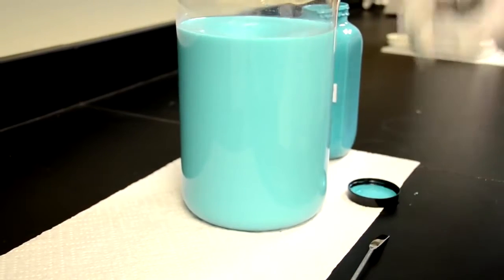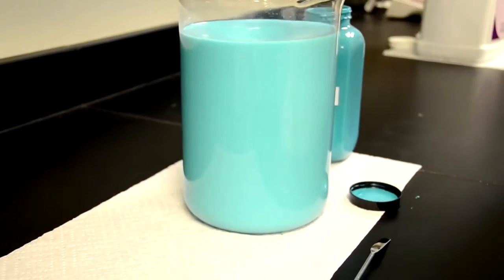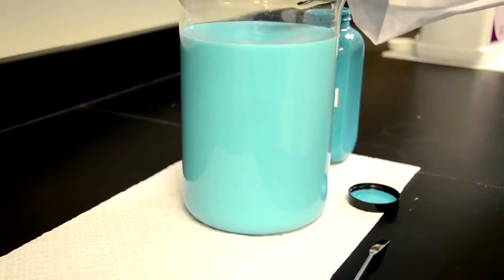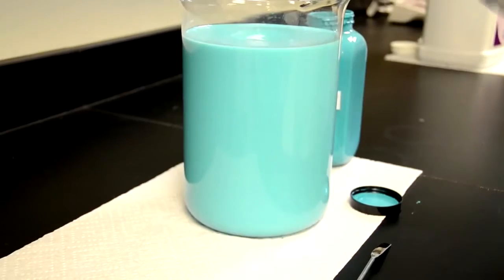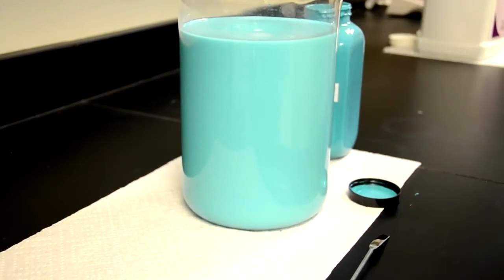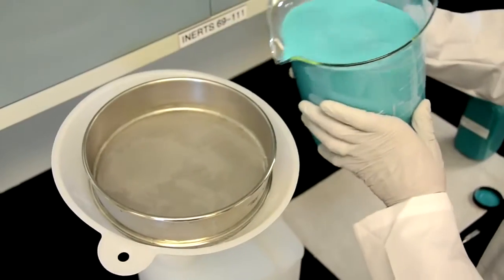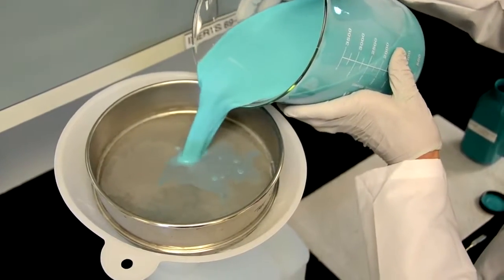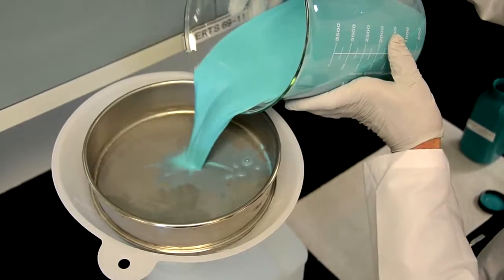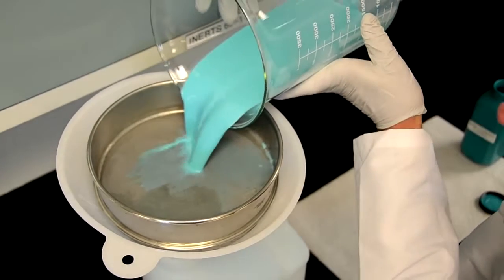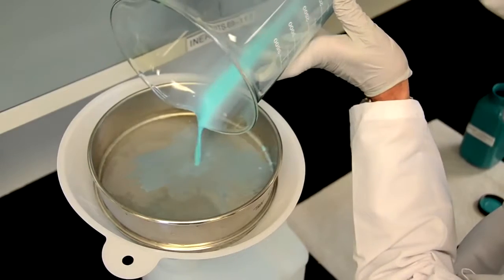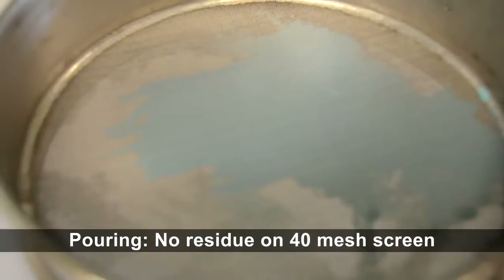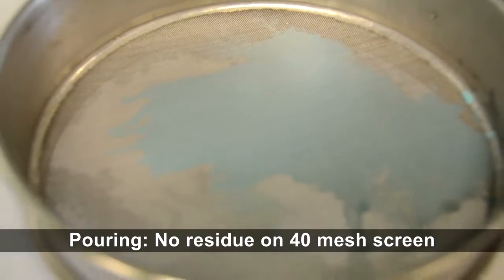And now what I'll do is take this mixture and pour it through a sieve to show the dispersion and the fineness of the product after dilution into water. I'm pouring this through a 40 mesh sieve. As you can see there's no residue on the screen.